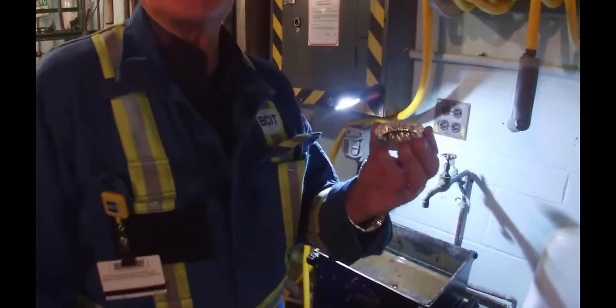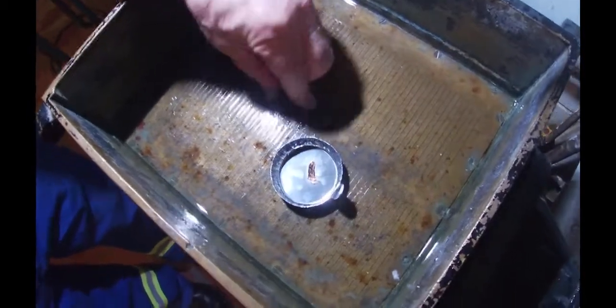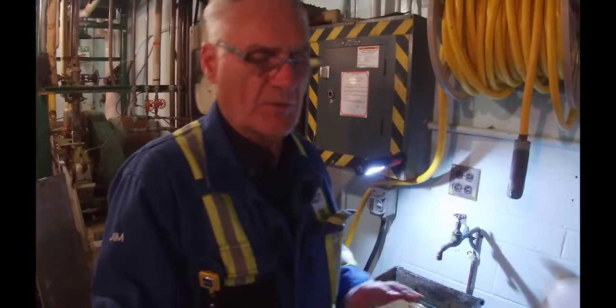I went upstairs and picked up three trays like this and I measured them. This one is 1.0233 grams. Now I can see that the fiber is all gone out of here — all that's left are those tiny little bits right there. So you're going to turn this off and collect those and put them in that tray. It's not very much. Now what we've got to do is put this in an oven and dry it out to find out the amount of dried fiber in that 1,000 milliliter sample. I've got two more to do so we get the average.